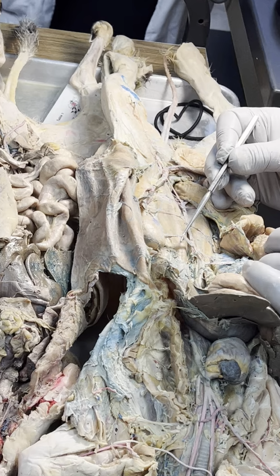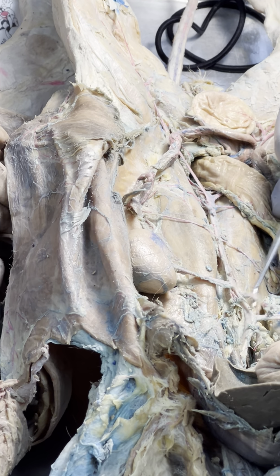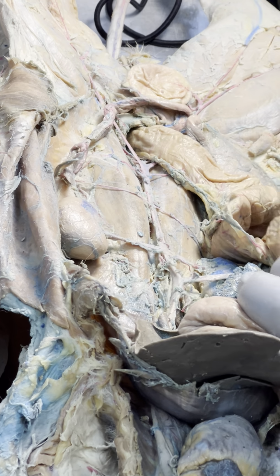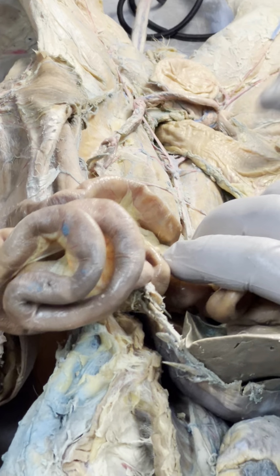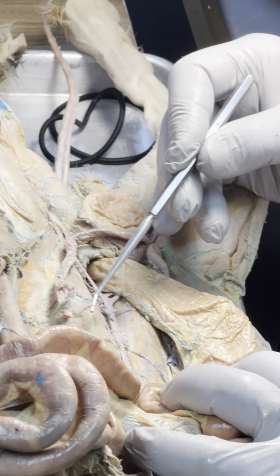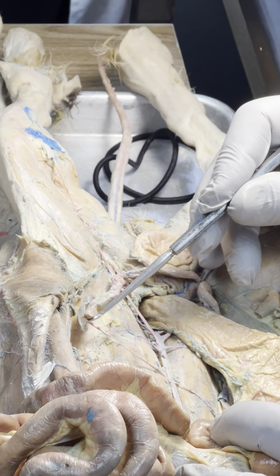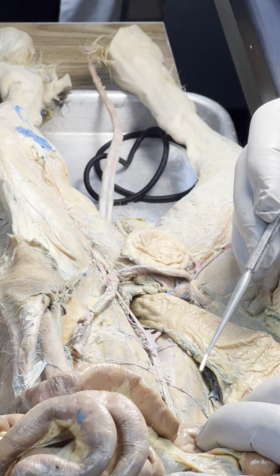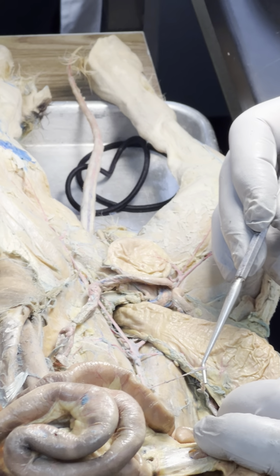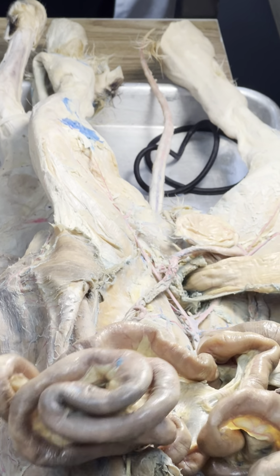Going to the kidney, so it's renal, but more specifically, left renal. And there's right renal. We're not doing these, but just because it's there, I gotta show you. That's kind of cool. That is the left ovarian, because it's going to the ovary. So we'll do right and left in the midterm? Oh, yes. Yeah. This one's right ovarian. But you don't need to know that, right? Here's the next one you do need to know.